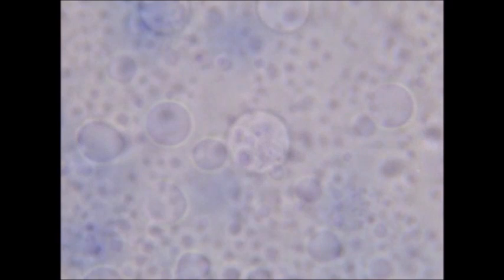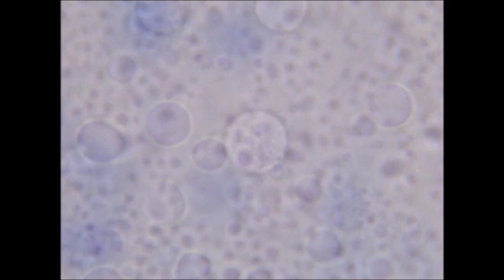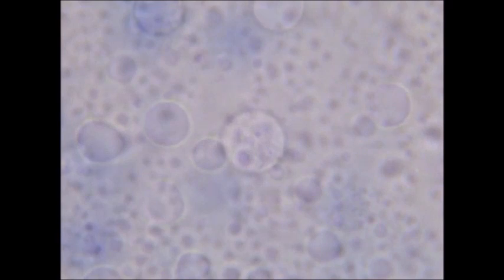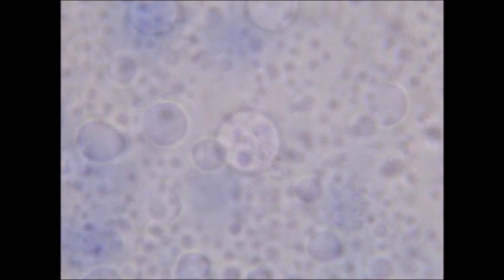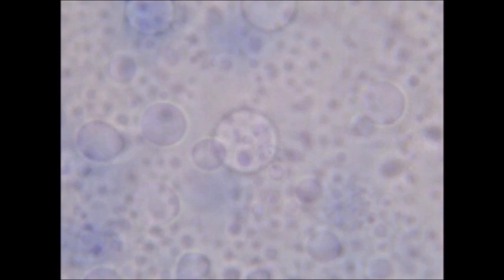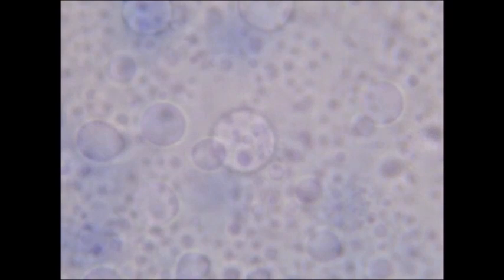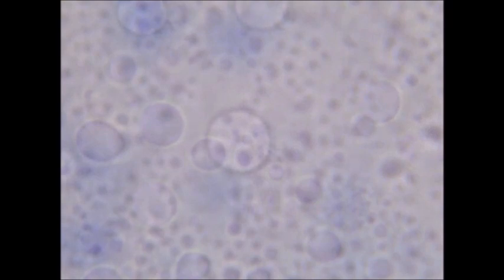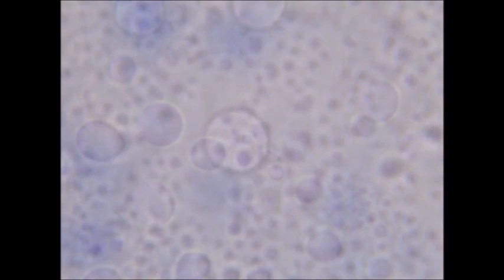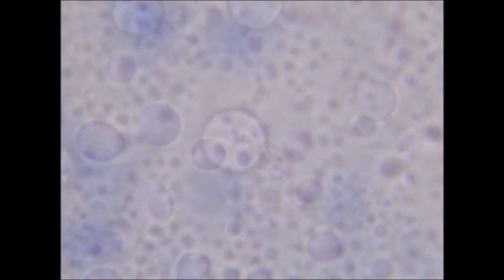And here again we have another case of vesicle assimilation. The one on the right, the larger one, is swallowing up the smaller vesicle on the left.